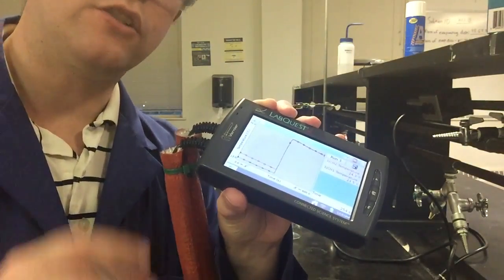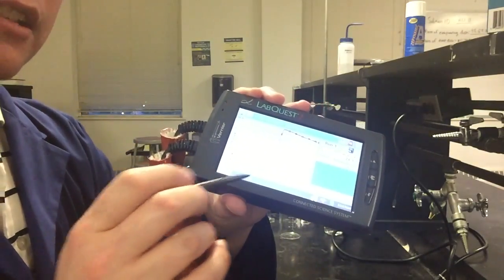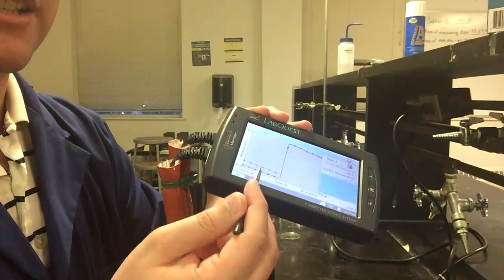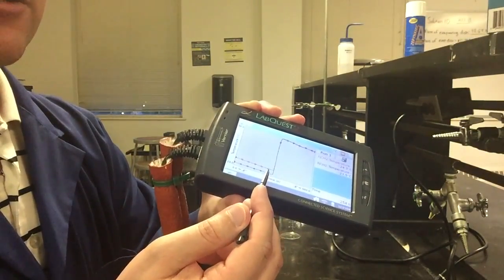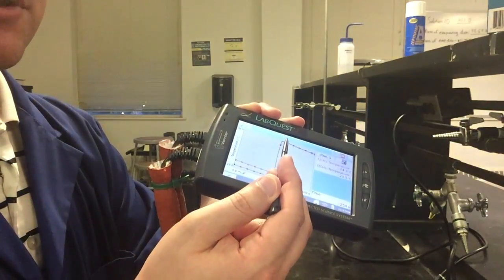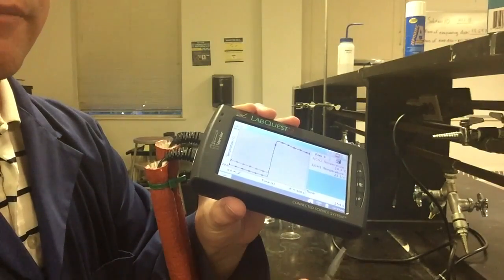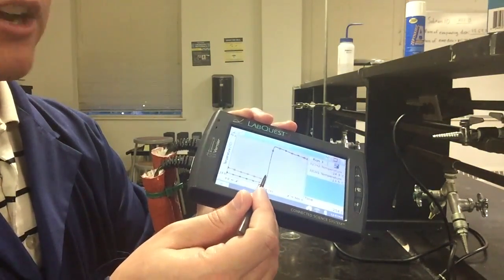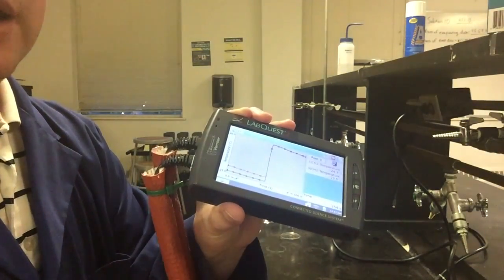All right, so quick look just at this data before I send everything back to everybody. It looks like we have our initial temperatures starting out at the bottom, apologizing for the glare. And so we see our temperatures down here are pretty constant. And as soon as we mix these two solutions together, we see that huge temperature spike before it starts slowing down. So again, your initial temperatures for your base and acid solution should be whatever they are right before they get mixed. And your final temperature is really your peak up here that everything gets to.